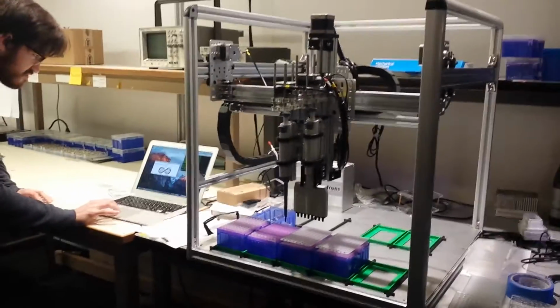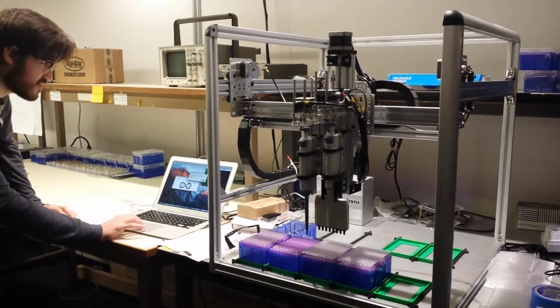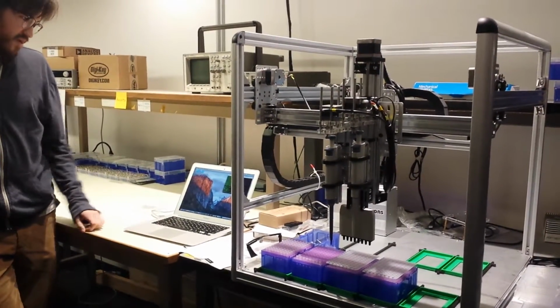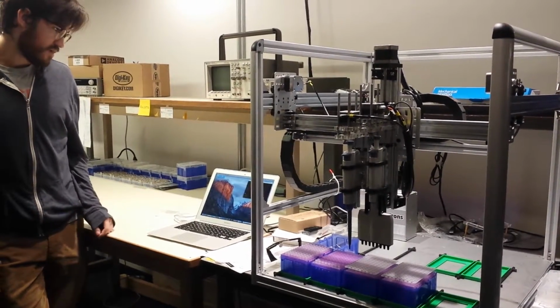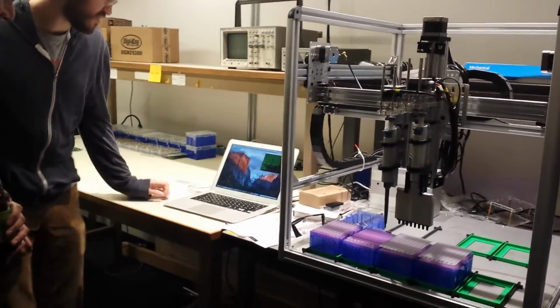Submit. So, the quick brown fox jumps over the lazy dog. Giving it a workout. Every letter in the alphabet. This little program we wrote is basically going to compile the text and turn it into instructions for the machine. Basically, it writes a file that we actually need to upload for the application to the machine.